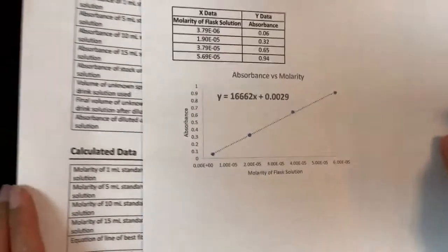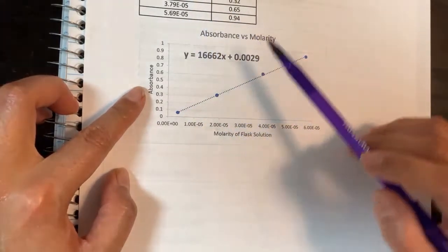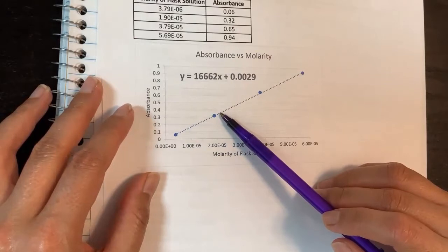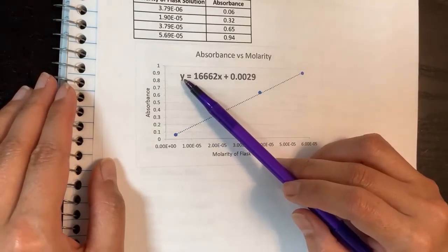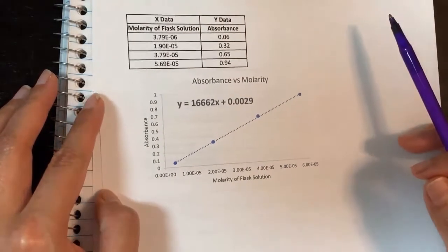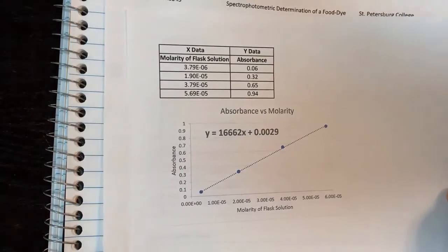The equation you get from the graph means y is absorbance and x is molarity. So if your unknown absorbance was 0.35, you can see it falls somewhere on the graph, but the best approach is to plug 0.35 into y in the equation and solve algebraically for x, which gives you the molarity of the unknown diluted solution. Take the equation from your graph and use it in the next calculation step for the Gatorade.